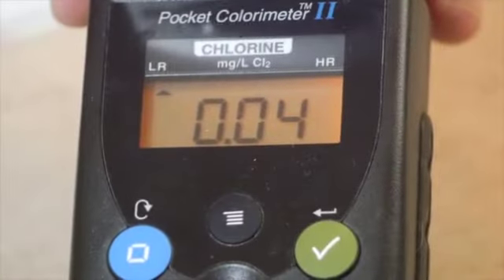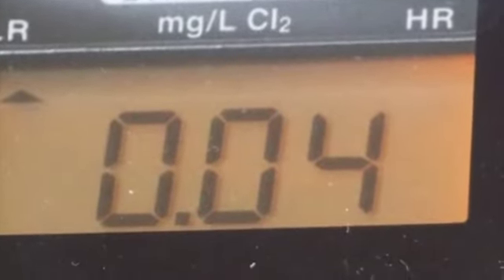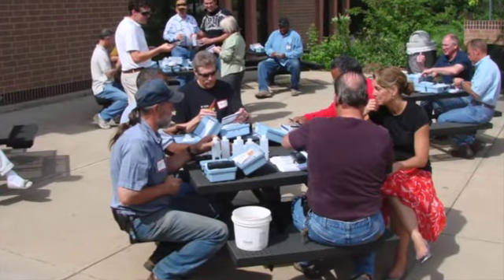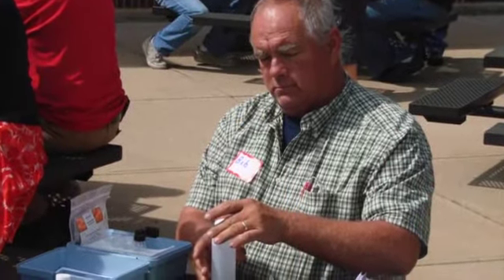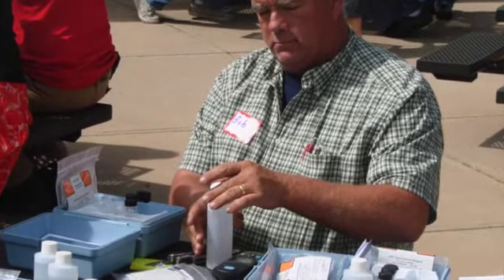Note that small interferences may be present. Just because the device has a number doesn't mean that chlorine is present. In our trainings using deionized water, no chlorine present, our students have noted residual concentrations ranging from 0.01 to 0.10 milligrams per liter. Recognizing this and identifying a reporting limit for your results is very important to ensure chlorine is present.